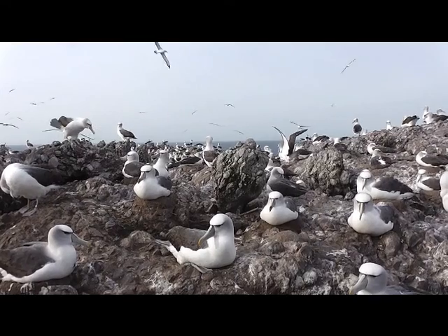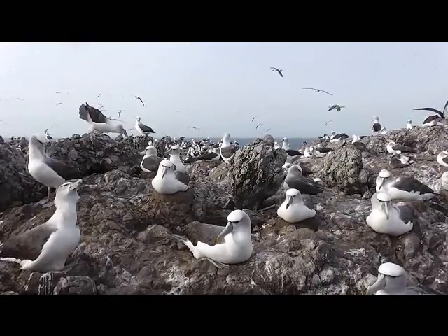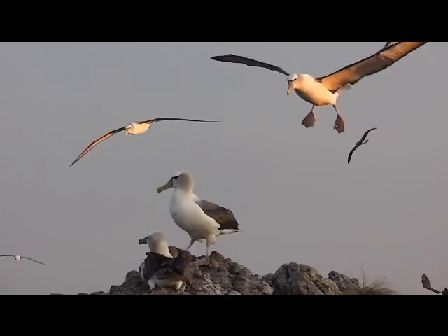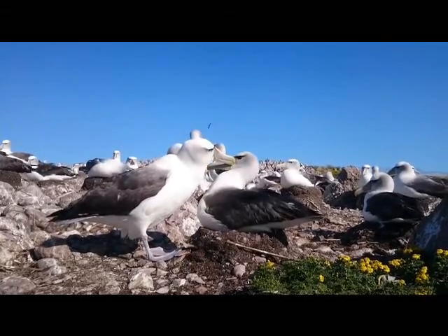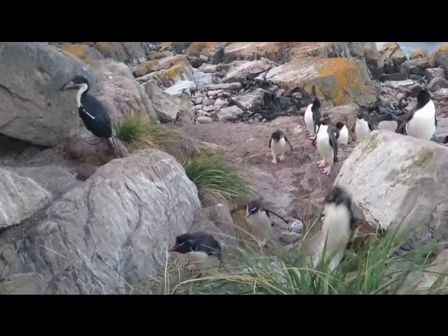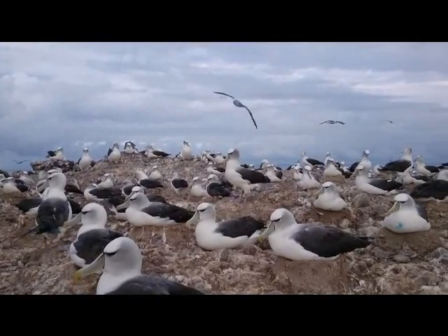We found that incubating birds, which had been fasting for extended periods at the nest, had minimal food DNA in their scats. Birds that had been at the nest for greater than 24 hours contained almost exclusively parasite and bird DNA. However, birds back for less than 24 hours had high proportions of food in their scats. Ideally target animals with minimal time since feeding, by watching those that have just returned from foraging. This may involve watching nests for incubation changes, or for some species, waiting at known access routes. Overall, where possible, avoid any animals known to have been fasting, including those building and defending nests.